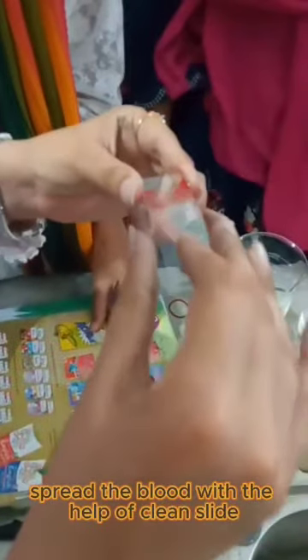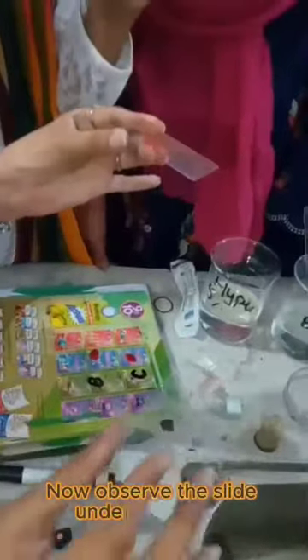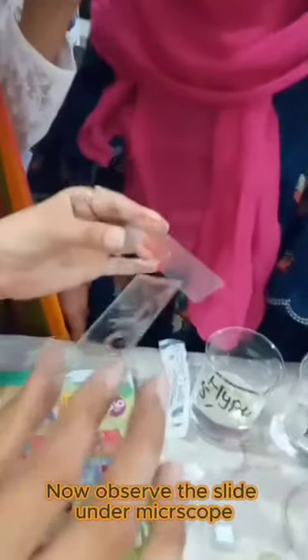Put some drops of blood on slide A. Spread the blood with the help of clean slide. Now observe the slide under microscope.